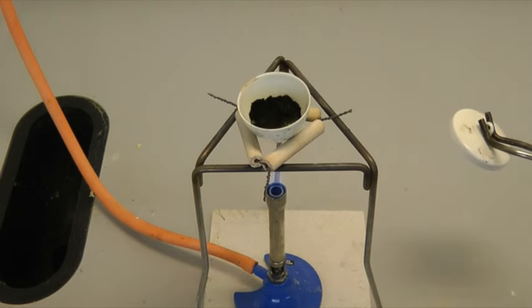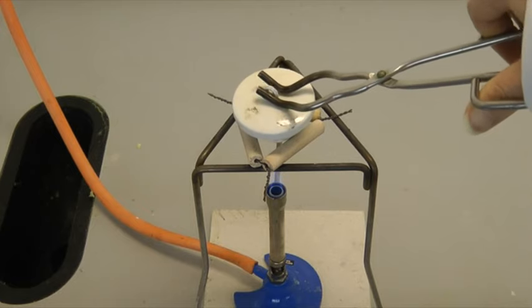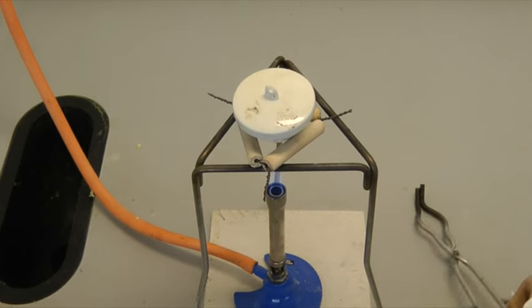Thermal decomposition of green copper carbonate leads to the formation of black copper oxide, as you can see in the crucible on the screen. In this case, we continue heating until no more green solid remains.